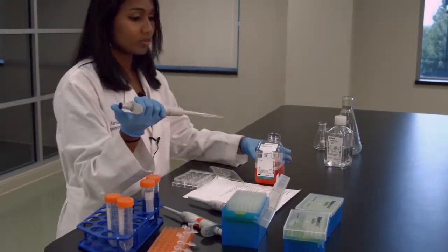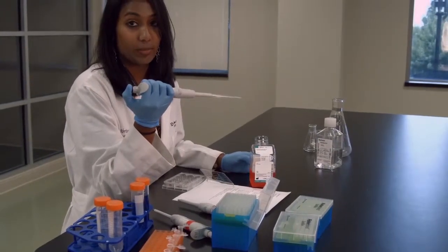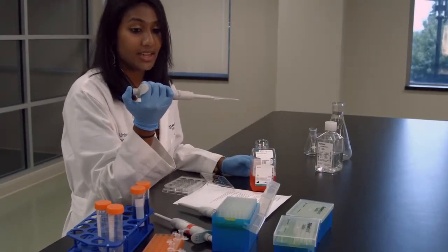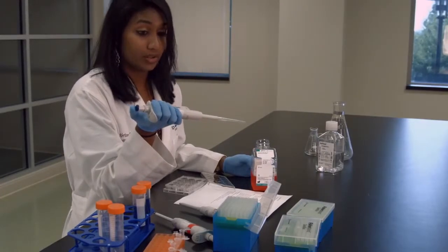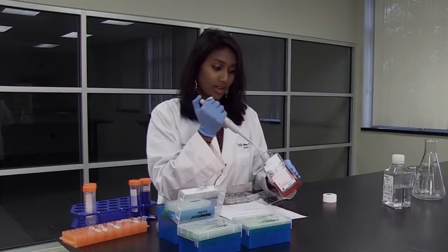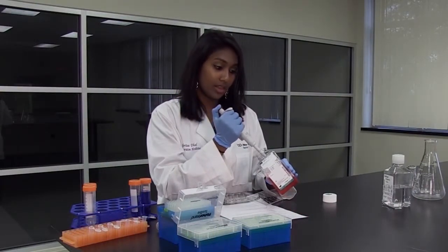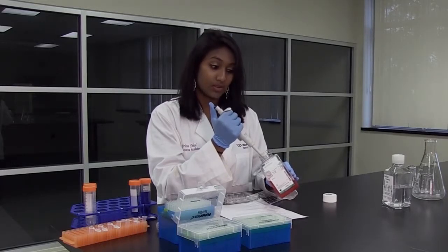Take it out, and with the micropipette, you will hear a stop — that stop indicates the set volume, in this case 800 microliters. We go into our liquid and press down to that first stop. When we reach the first stop, we let go, and that draws up 800 microliters.